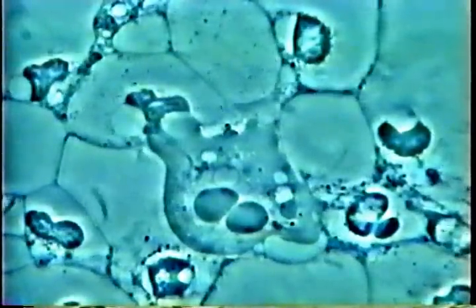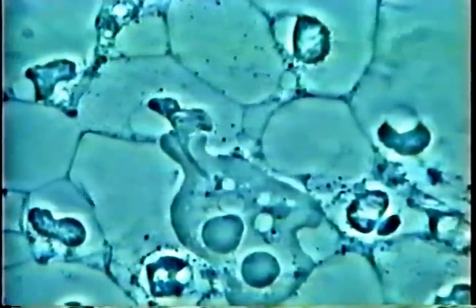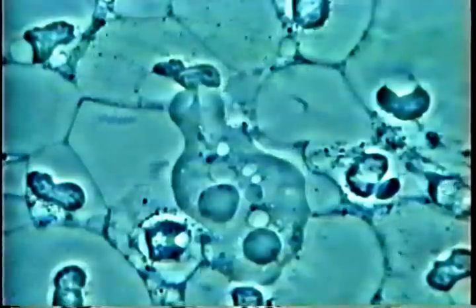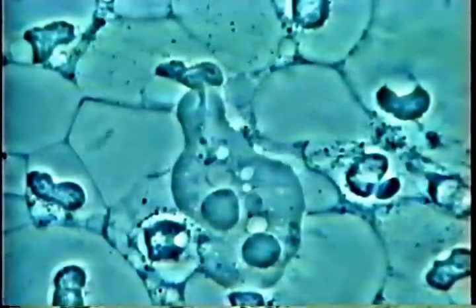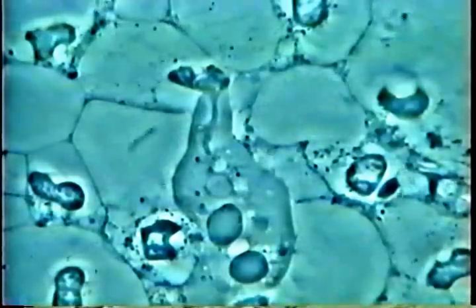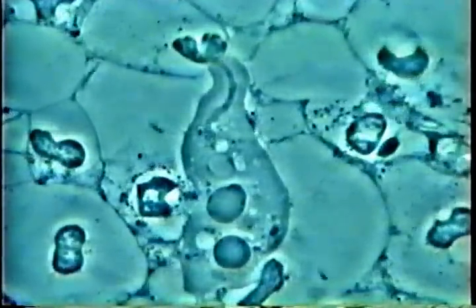In periodontal disease or gum disease, we see that the sulcus inside the gum around the teeth is full of white cells — those rounded cells that you see. In the middle you see typically the amoeba, the protozoa Entamoeba gingivalis, which is actually feeding on the nucleus of a white cell. You can see it suctioning the nucleus — it has taken maybe one fourth of the nucleus.